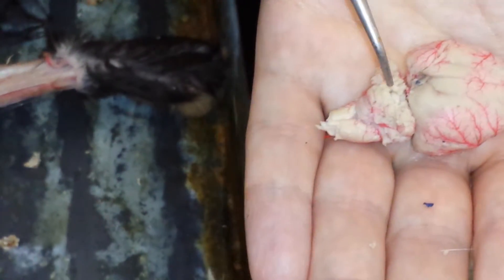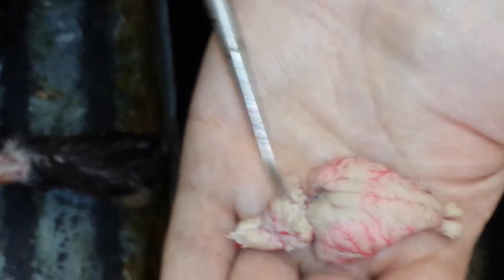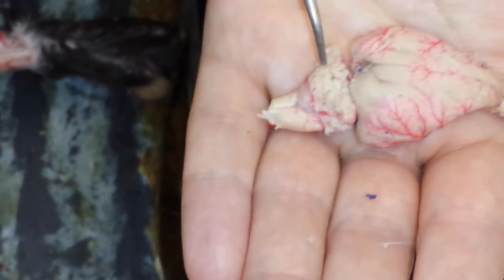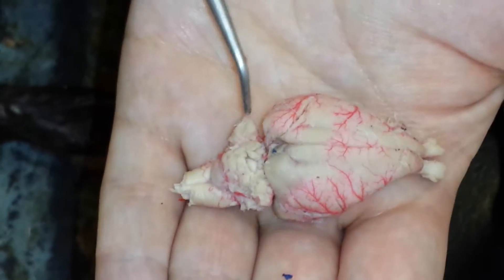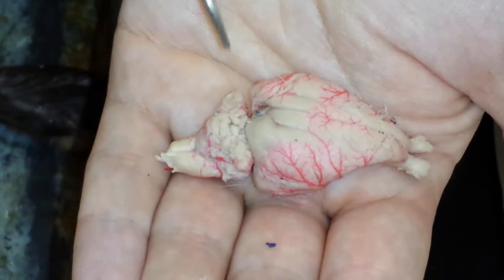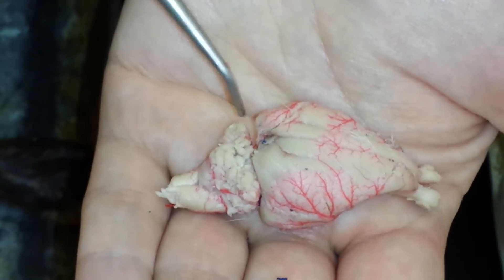You'll notice that we have the cerebellum, and it's broken up into three structures on each side. The vermis is the part that goes right down the middle here — named because it looks like a little worm. Then you have the cerebellar hemispheres, one on each side. And the flocculus is this little bumpy round thing that sticks out on either side — that's something the rabbit has that the sheep does not really have. So the cerebellum has three parts: the vermis in the middle, the cerebellar hemispheres, and then the flocculus sticking out.